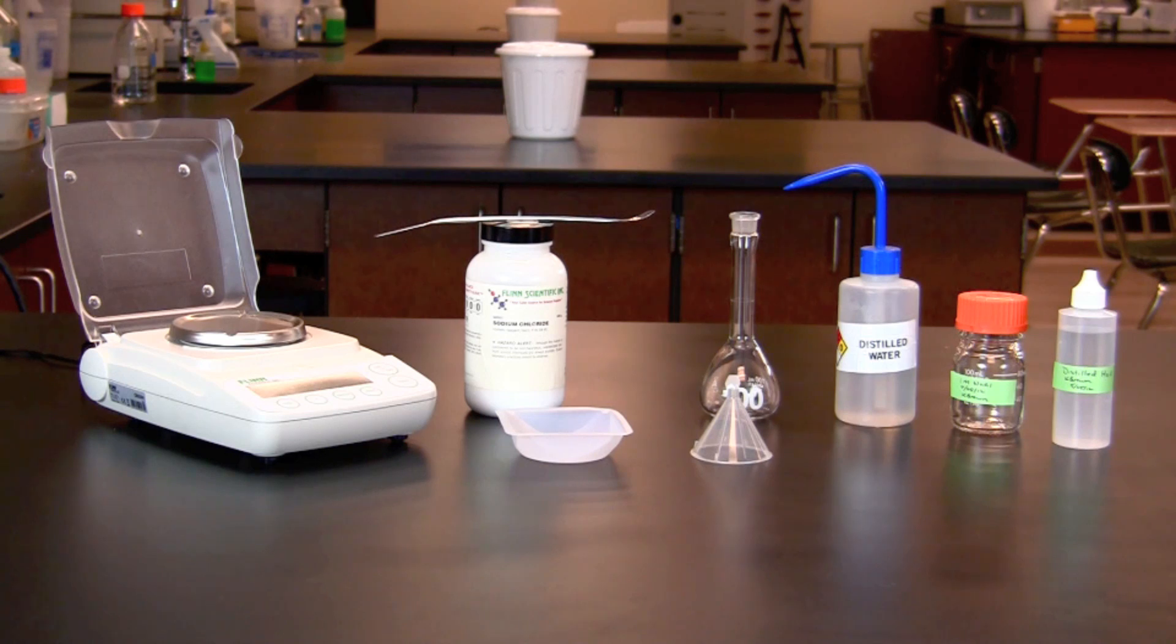In this video you will learn how to make a solution. We will be making 100 milliliters of a 1 molar sodium chloride solution.